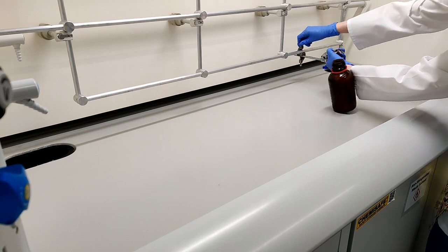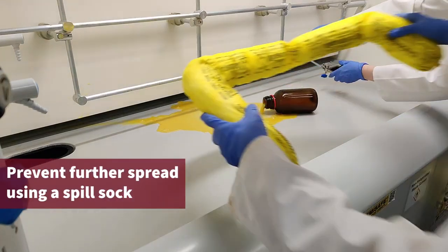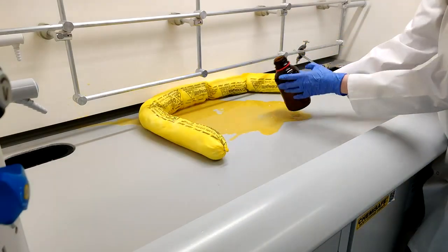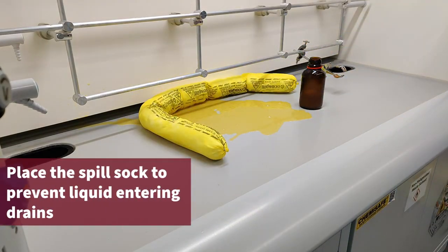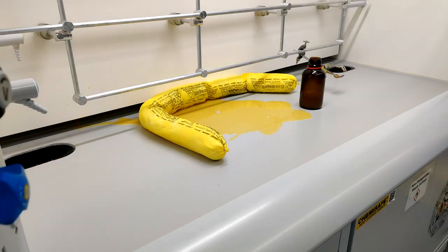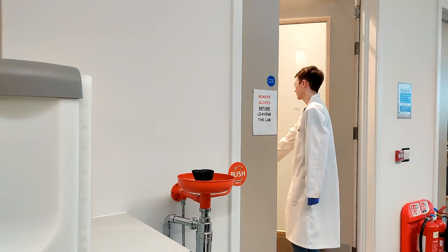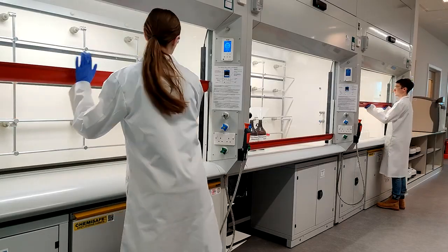The first step to tackling a large liquid spill is to prevent the spread. To do this, you should use the spill sock from the spill kit to make a barrier around the edges of the spill. When placing spill socks, ensure the liquid cannot enter any drains. If the substance is volatile, close doors to prevent the spread and increase ventilation through windows and fume hoods.